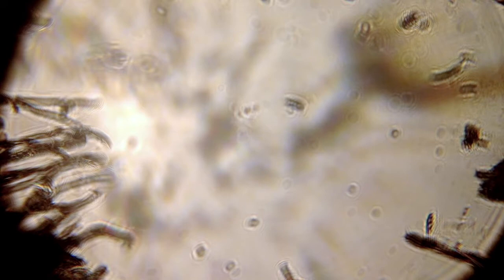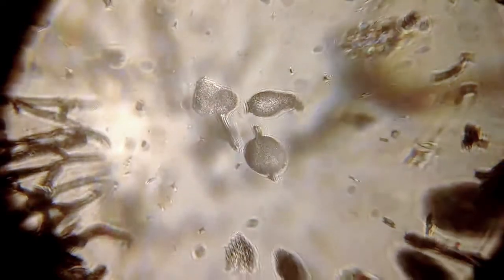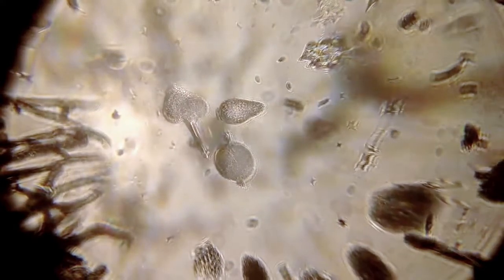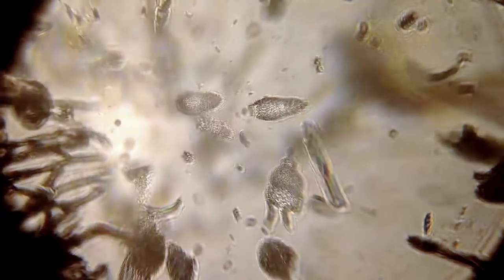Now I'm going to hold a slide from a vendor up, and you can see the microbial world on your webcam. So these are radiolaria from the ocean. These are the skeletons of different kinds of radiolaria. There's three nice ones right there. There's some more, lots of different kinds of radiolaria on this. This is just, like I said, a fixed slide of skeletons that I just bought at a teaching warehouse sort of thing. Lots of different kinds of radiolaria there.